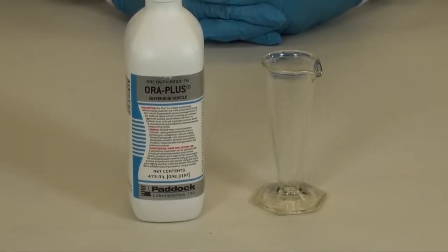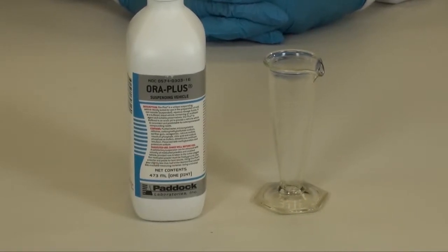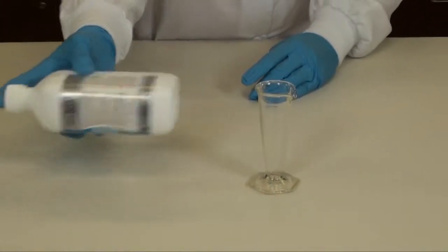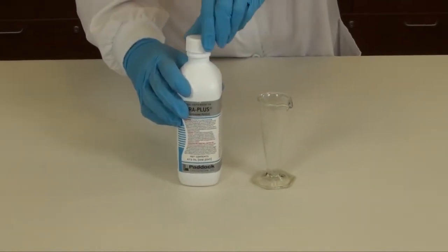You're now ready to measure the required amount of your suspending agent. In this case, we are using ORA Plus. Remember, your suspending agents need to be shaken well prior to the measurement process.